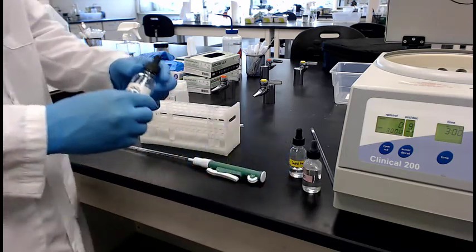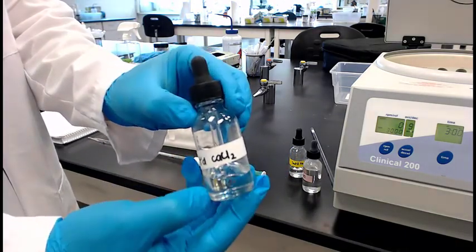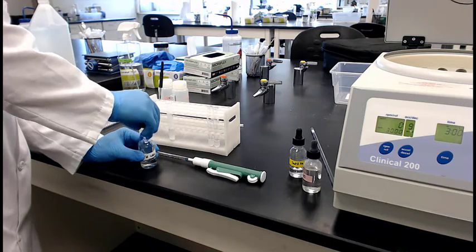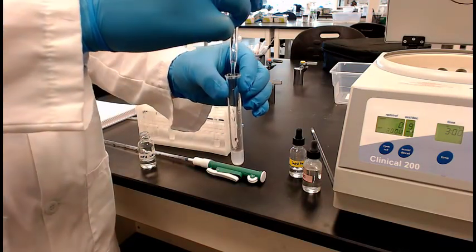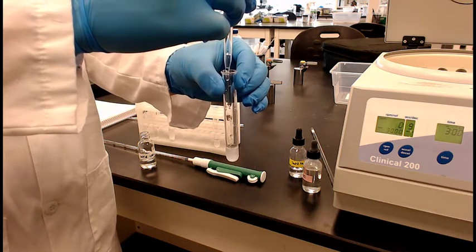To one of them, we're going to add saturated calcium chloride. That's step 5. So let's see what happens. Again, look at your reaction sheet. You now have the fluid that's at equilibrium. And now we're going to stress it by adding more calcium chloride. So think about what you're adding when you're adding calcium chloride.